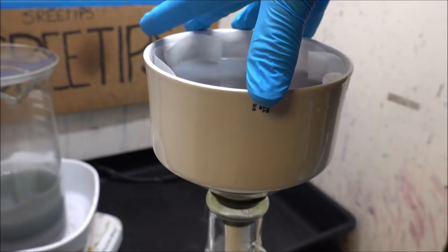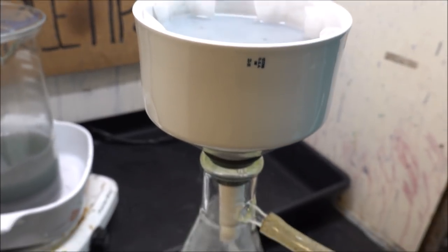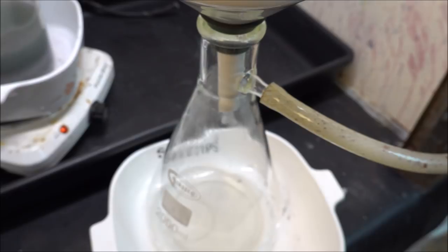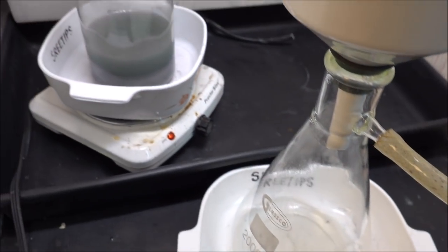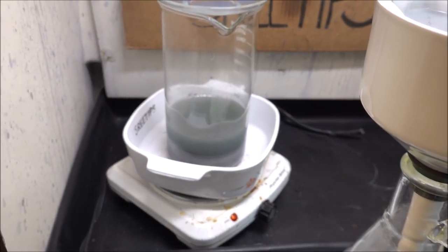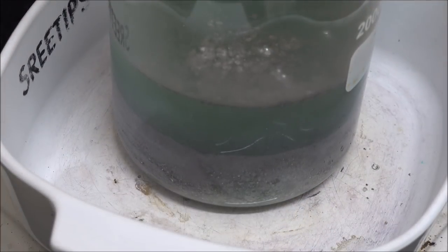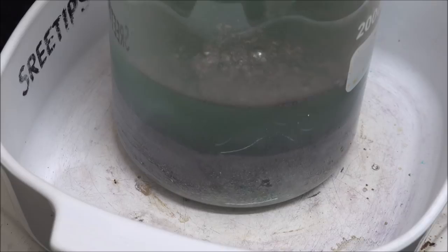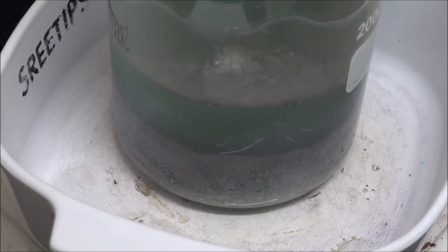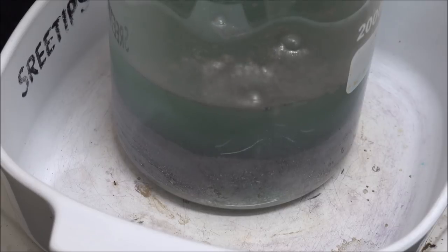I'm gonna cover this up here and we'll put this up on the heat. I'm filtering the solids out of this liquid. After we got all the liquid out of there, we'll add the filter down here to this beaker. We got some heat going to the beaker now. Hydrochloric acid in there with the material that's been ground up.